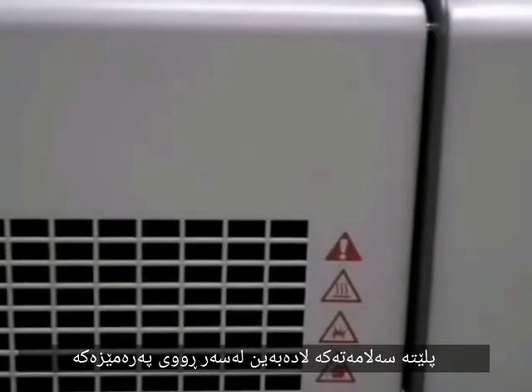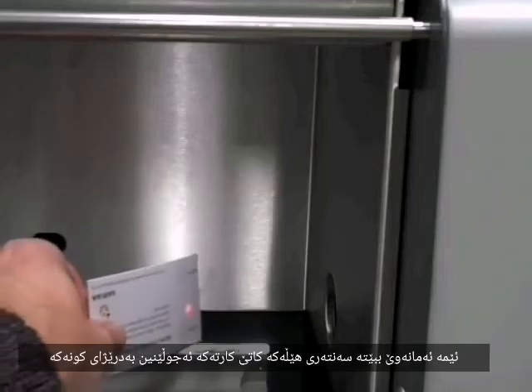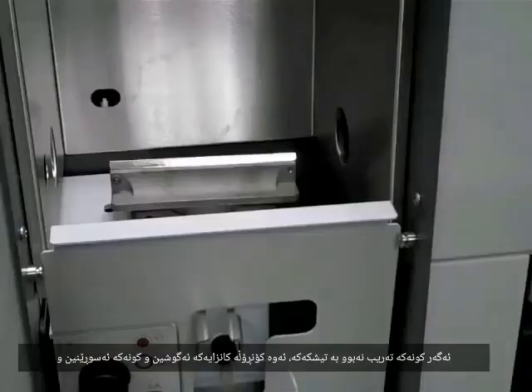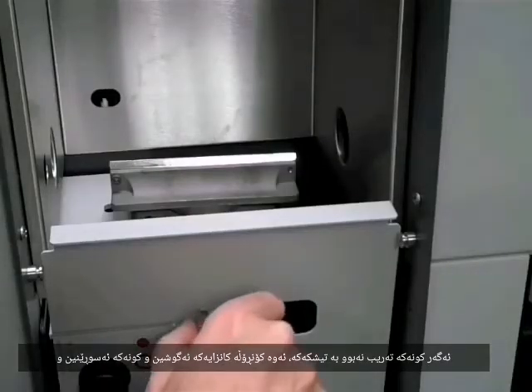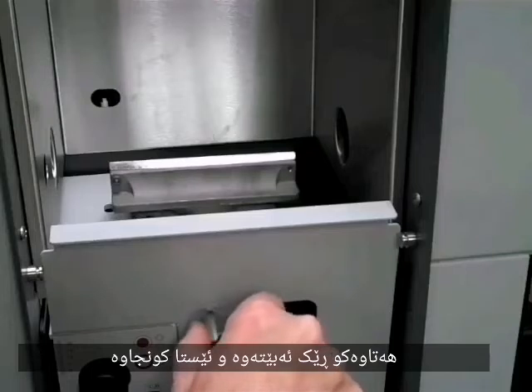Remove the safety plate in front of the burner. Position the vertical line on the card directly over the slot on the burner. We would like that beam to be centered on the line as the card is moved along the slot. If that slot is not parallel with the beam, squeeze the metal control grips and rotate the slot until the alignment is proper.